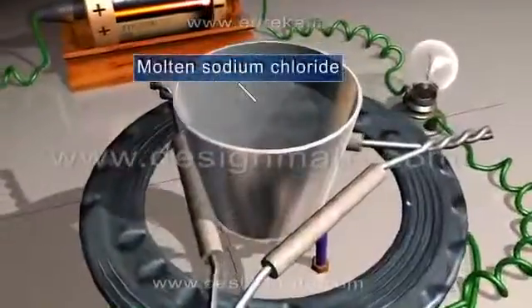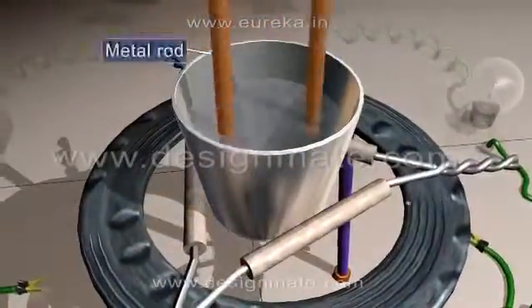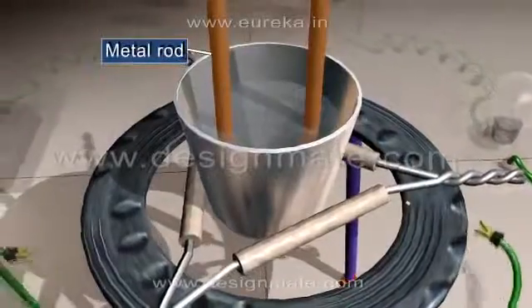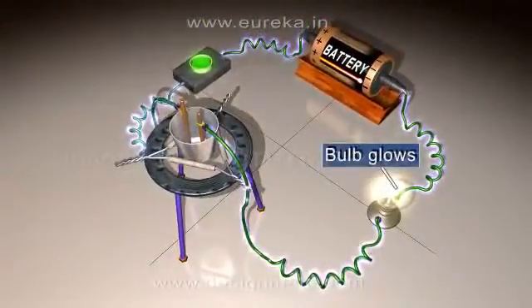Take some molten sodium chloride in a crucible. Introduce 2 metal rods and connect the circuit as shown. We observe that the bulb glows, indicating the flow of current.